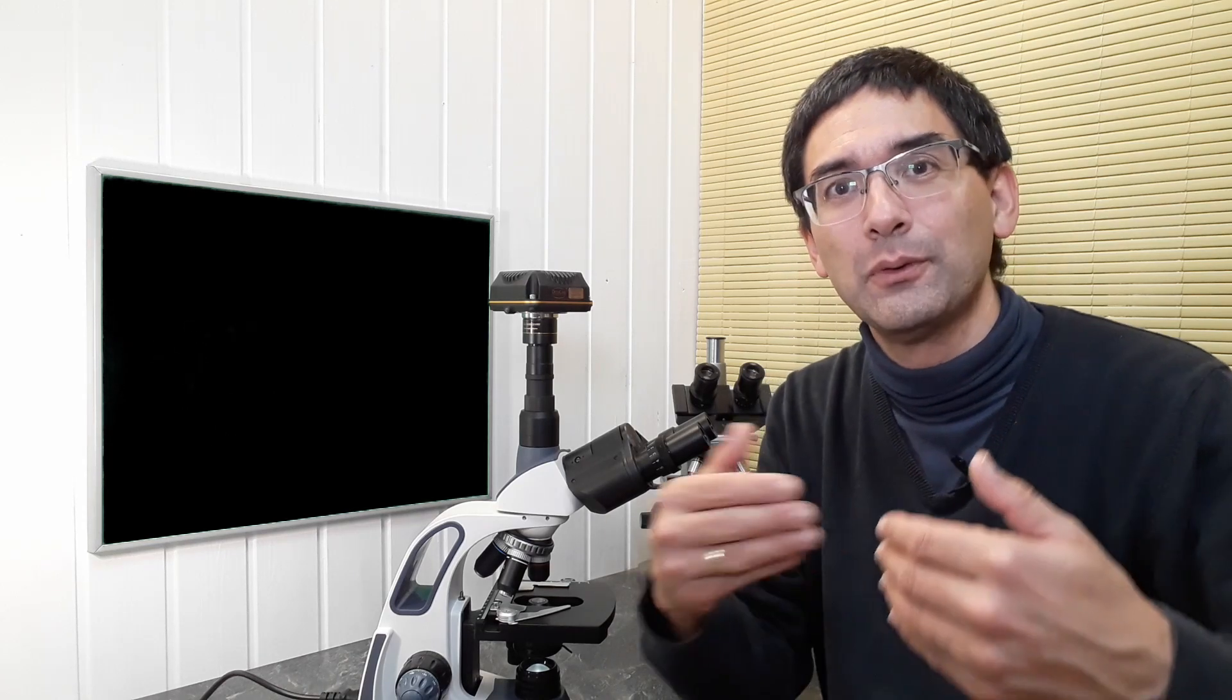Well, first of all, thank you for the question, and the answer is not as straightforward, so I'll step you through the process. In principle, it is possible, but it depends a little bit on your microscope, and let me explain this.